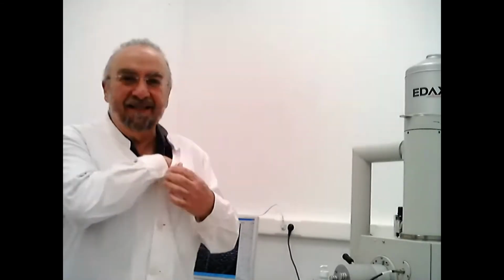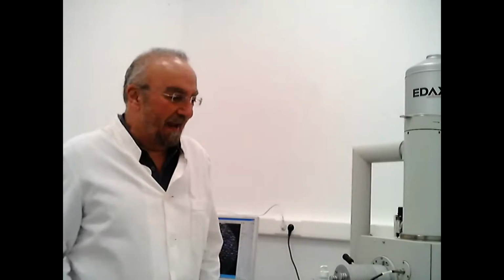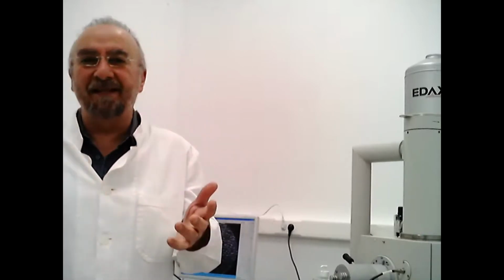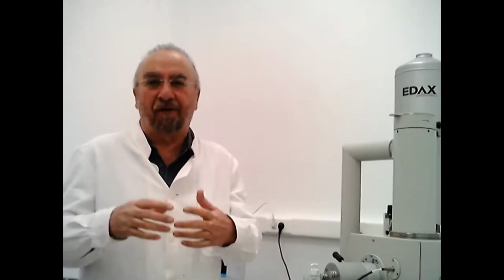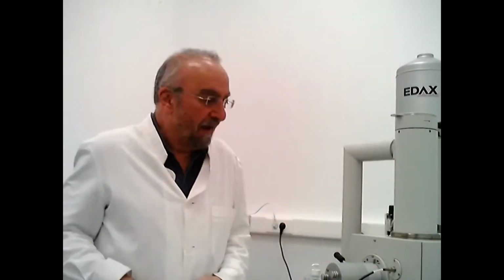This is an unusual situation. We are inside the room of the Scanning Electron Microscope, and I'm going to show you something quite interesting today. You've all heard of forensic science and investigations of a criminal situation. So today we're going to show you a real situation, how we forensic scientists actually analyze the minute findings.